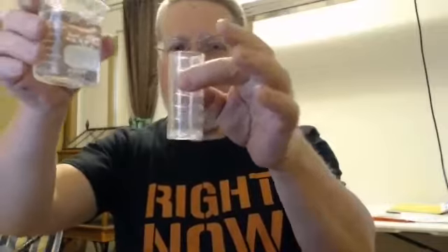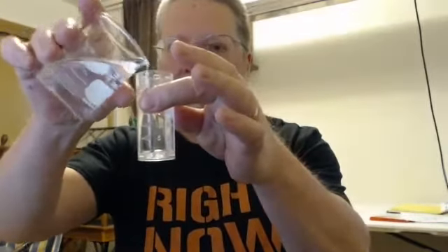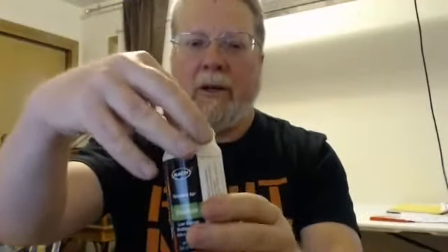Take the water you want to test and fill the sample tube up to the line that says 25 milliliters right here. We're going to begin today with a test of chloride. So this green colored item, you'll take out this Quantab.